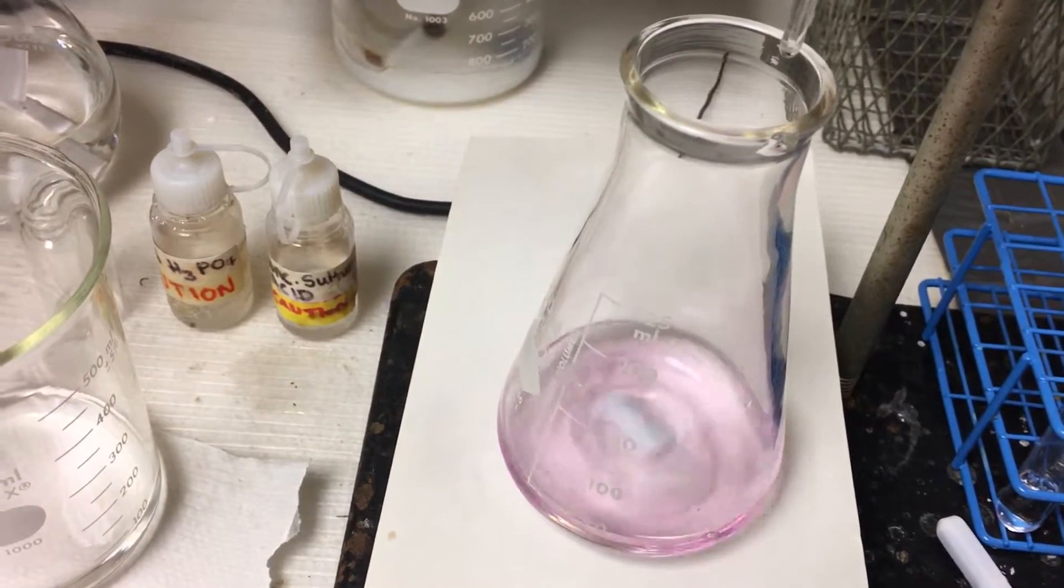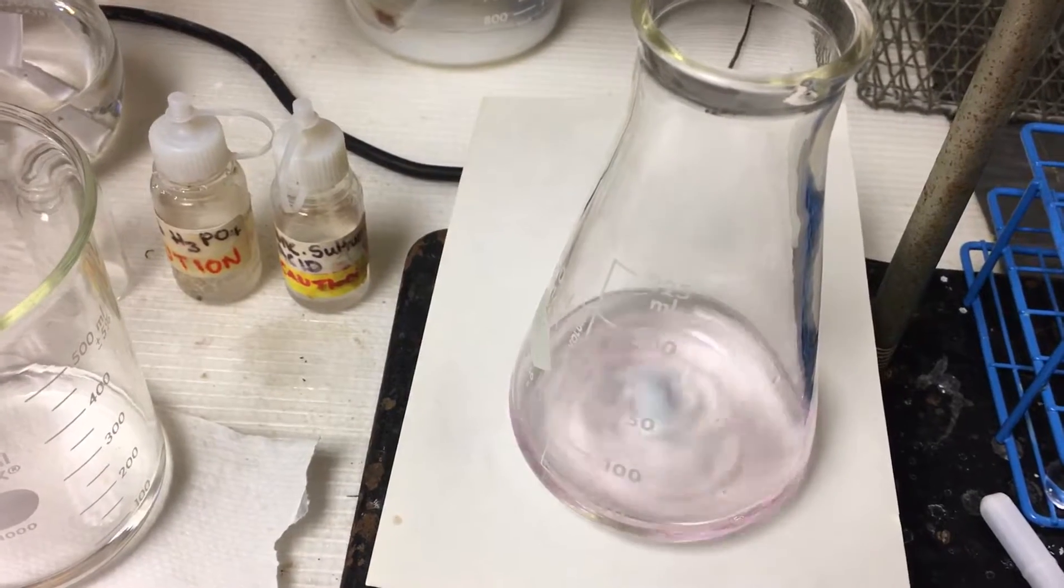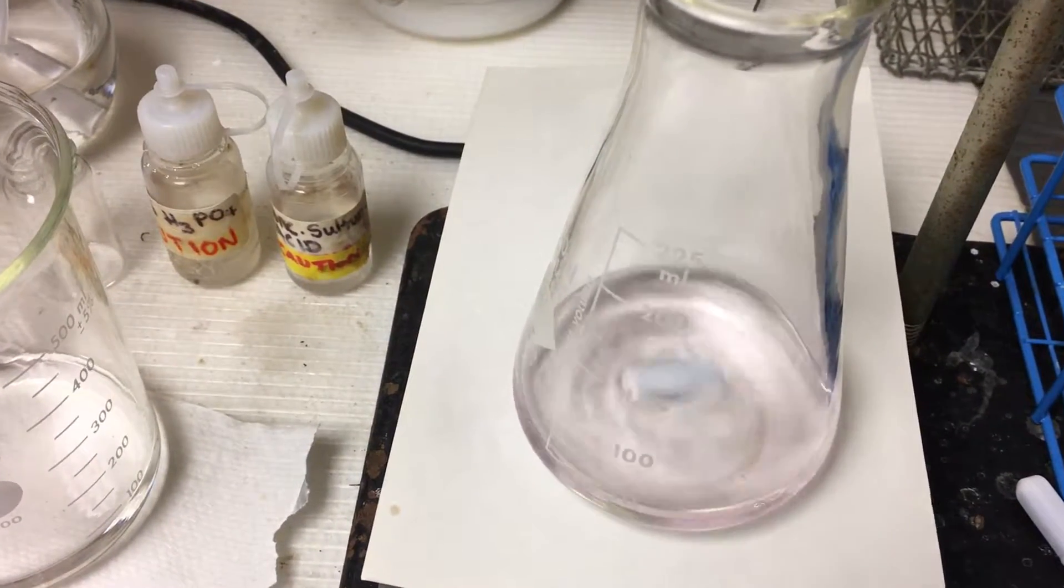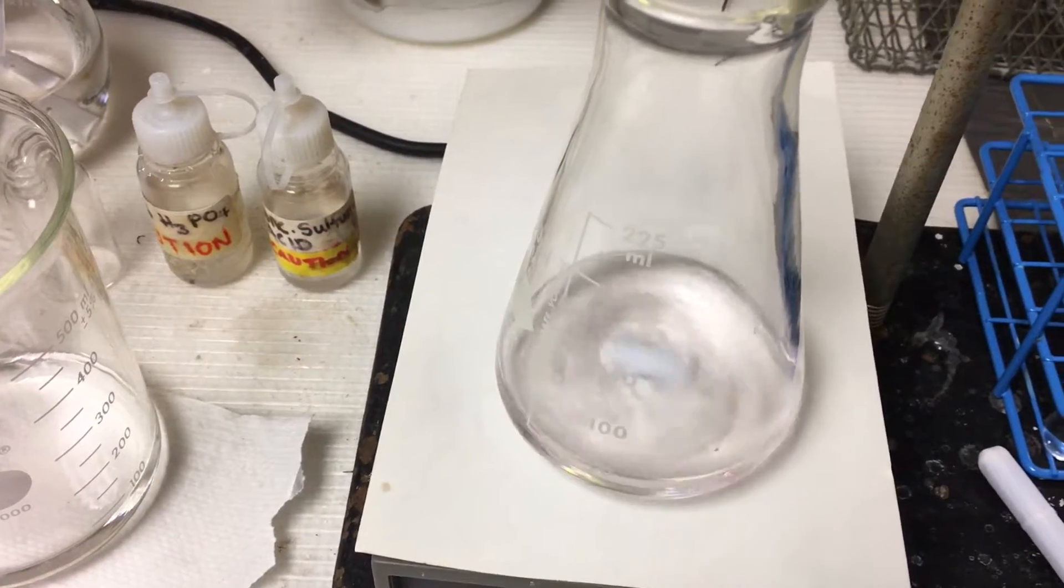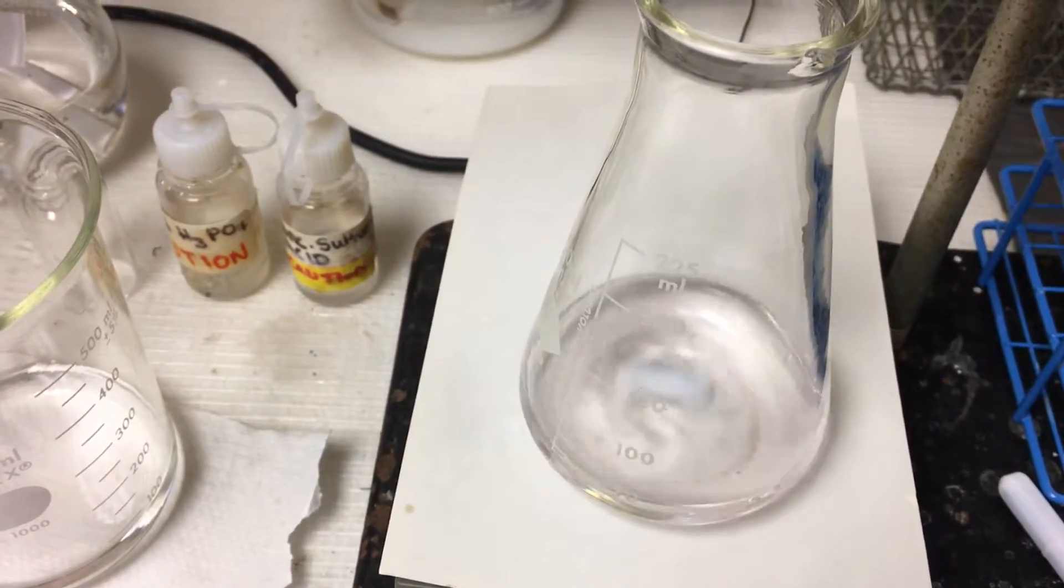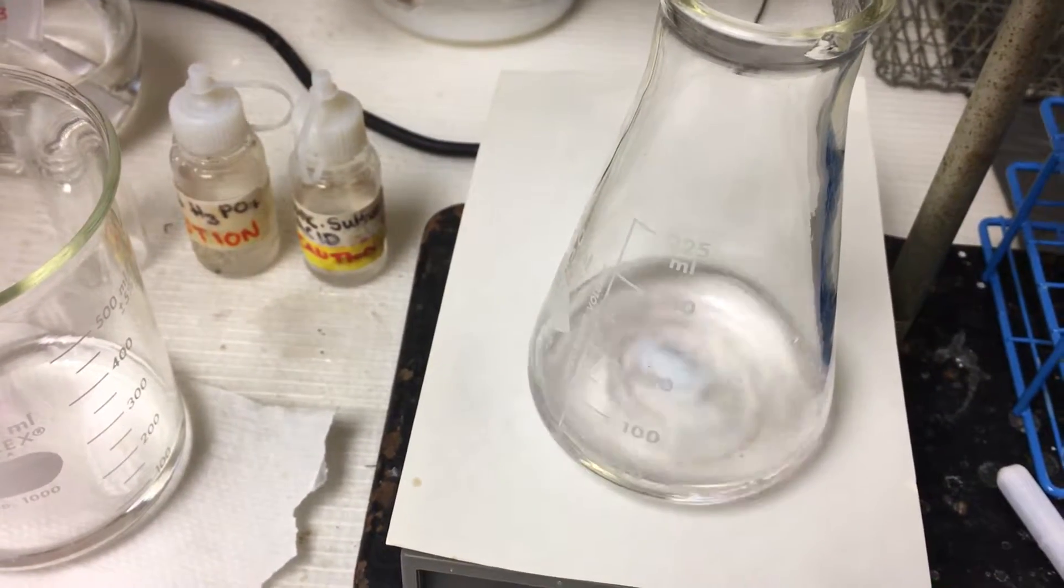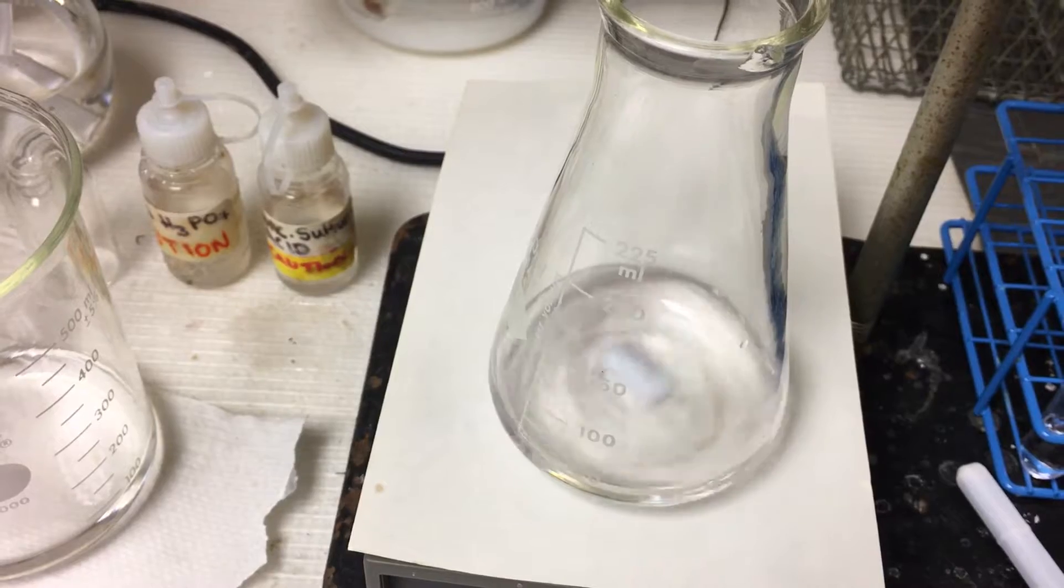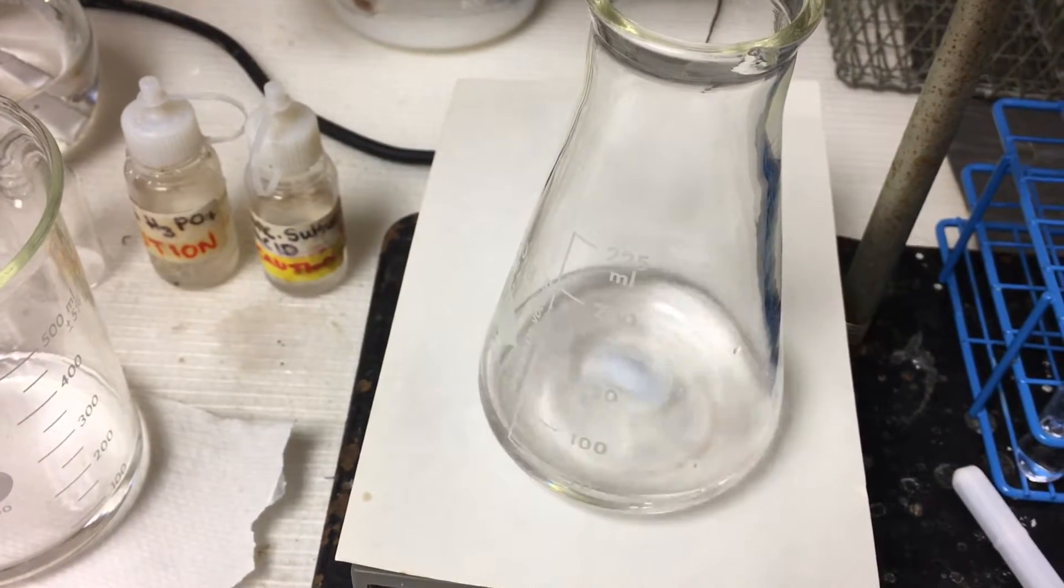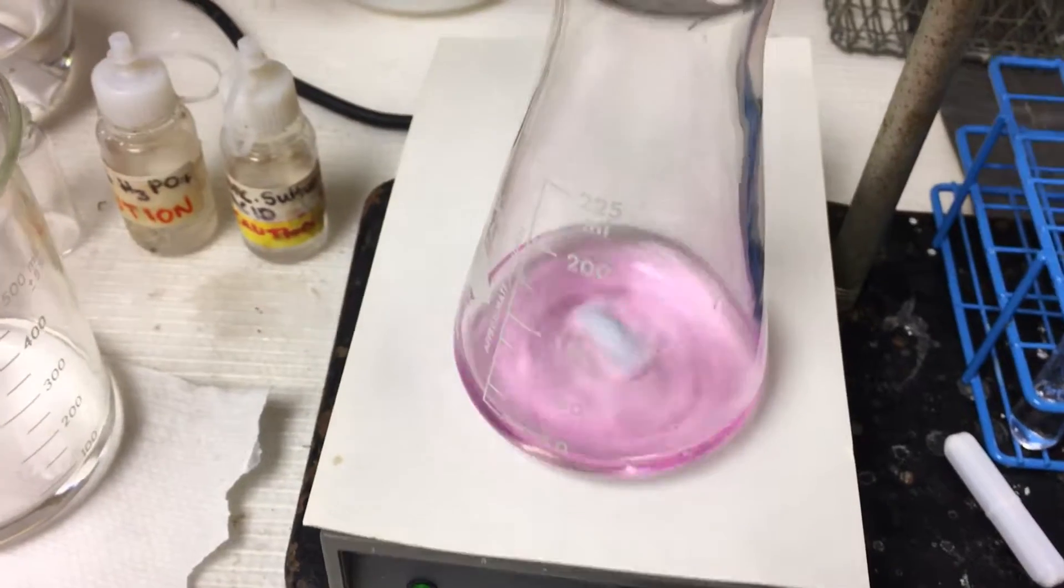Still need another drop. Okay, we're gonna try one more drop. Half enough. All right, just one drop gonna change the whole thing. Just one little drop. There I go. Got it.